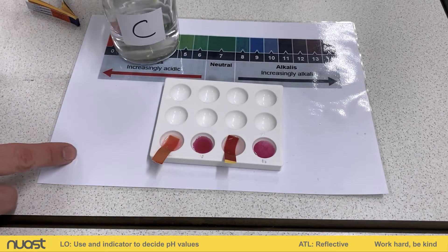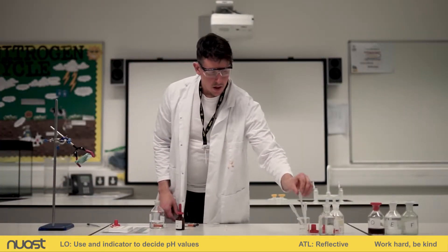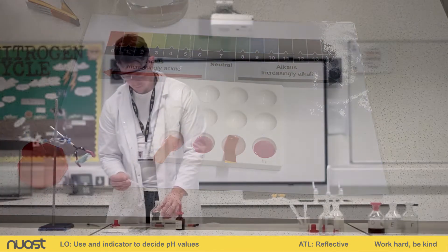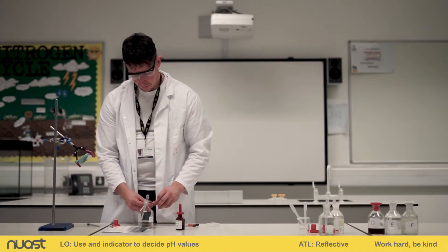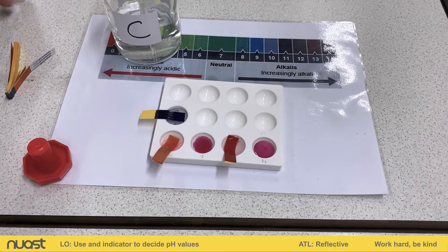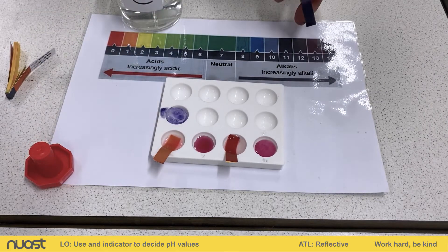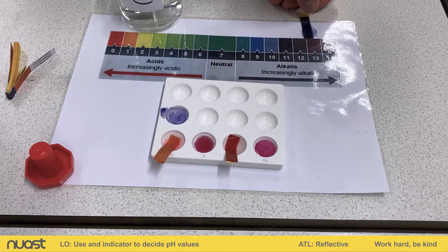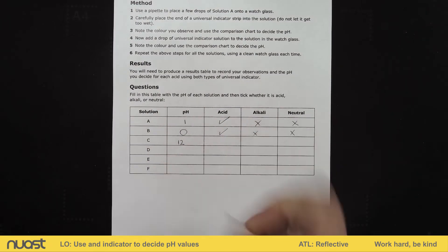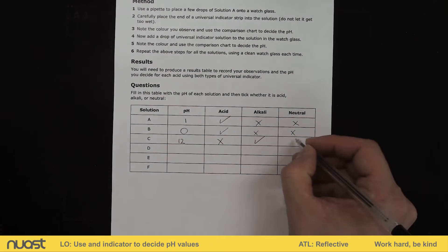We're going to move on to solution C. This time I'm going to give you a chance to have a look at the pH and the colour, and see what you think the acidity or alkalinity of this will be. Adding the same type of universal indicator paper — pause there and try and fill in for yourself the solution C section of the table. I'd say this is a dark purple, approximately around 12 to 13 on the pH scale. Since it's pH 12, we can see that would mean it is an alkali — so it's no longer an acid, it is an alkali, it is not neutral.